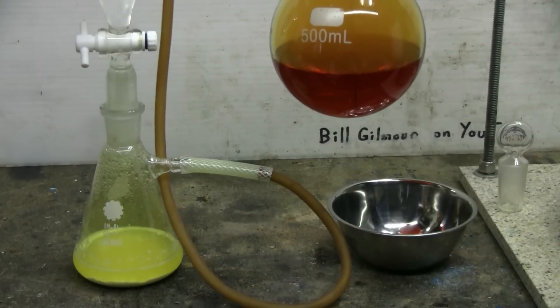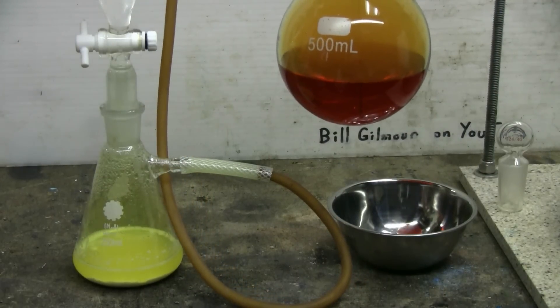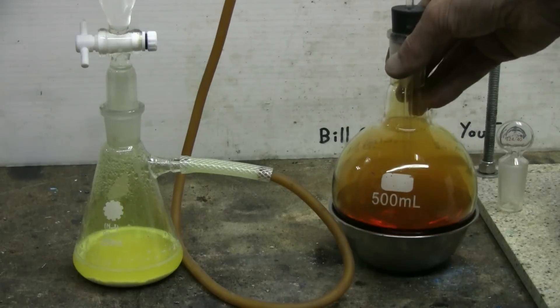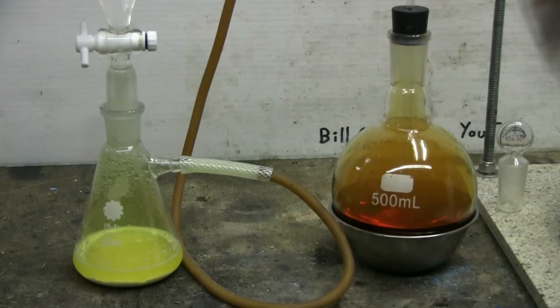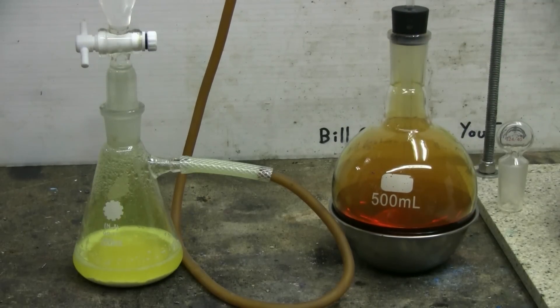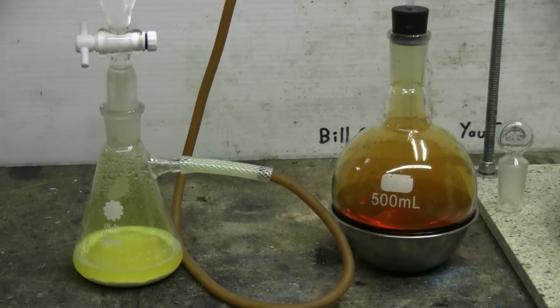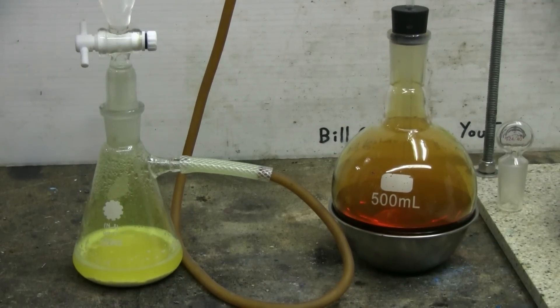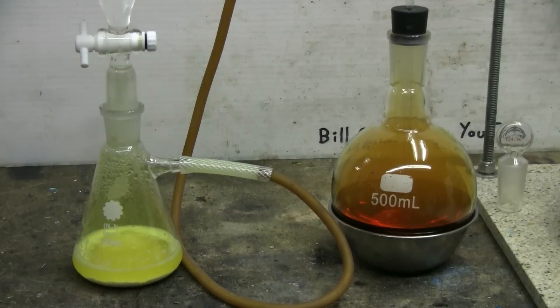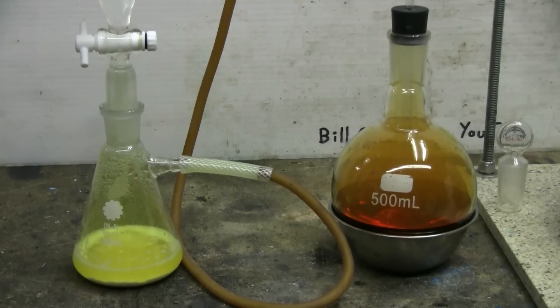This reaction will be nearing completion and I will pick up the video when I am ready to set up for the simple distillation of bromine.